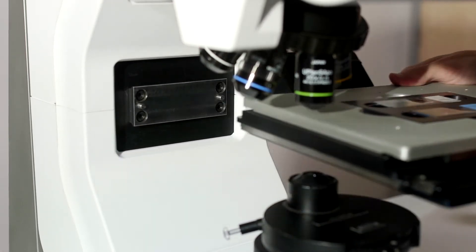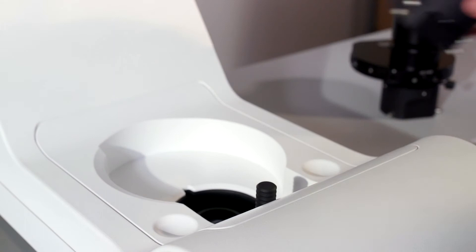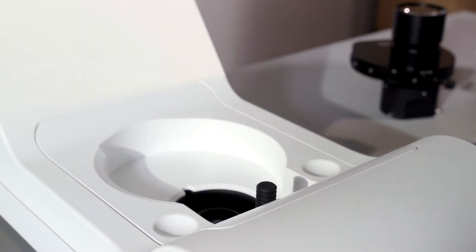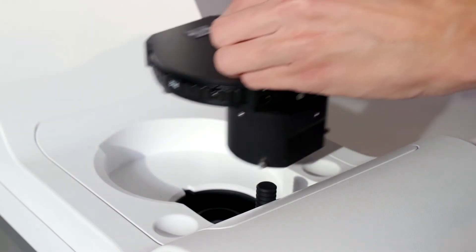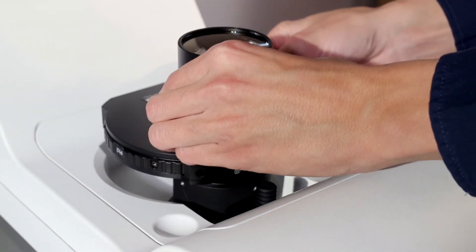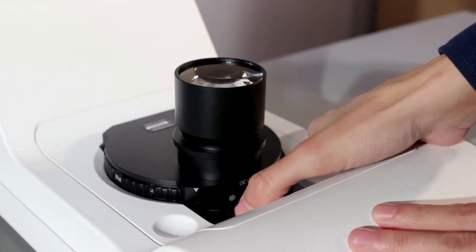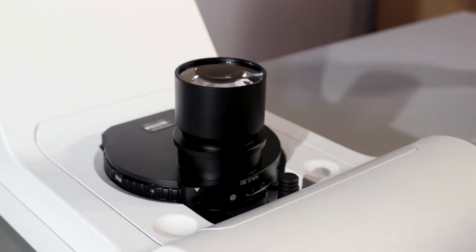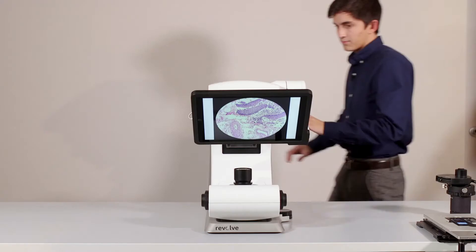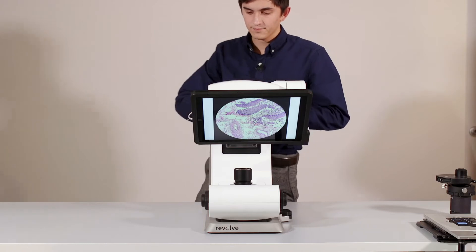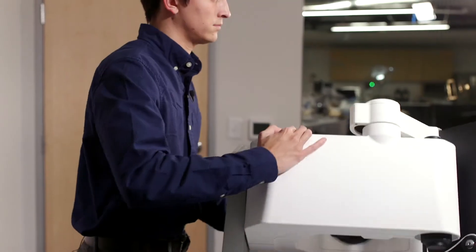Next, I'll remove the high-resolution condenser, typically used for upright imaging, and now I'll install my long working distance condenser, which is used for live cell applications. I'll then bring down the optical arm on the iPad, and I'll click the button in the back to revolve the microscope.